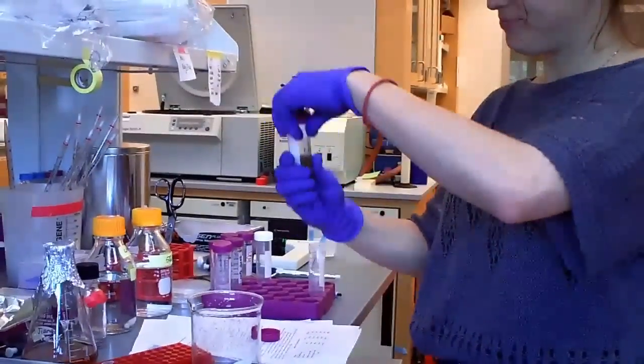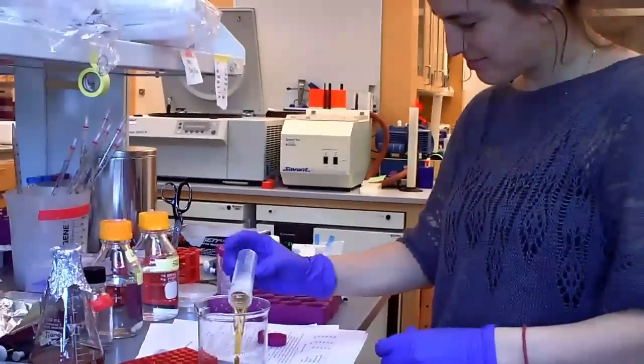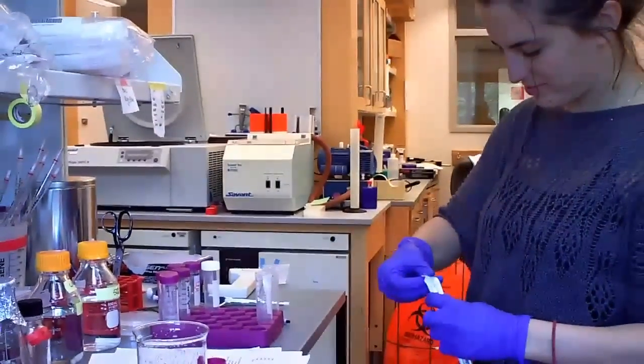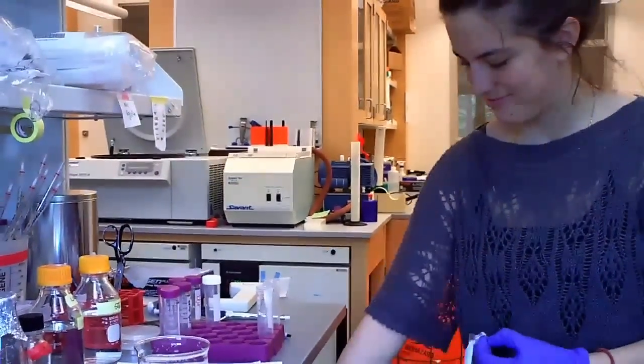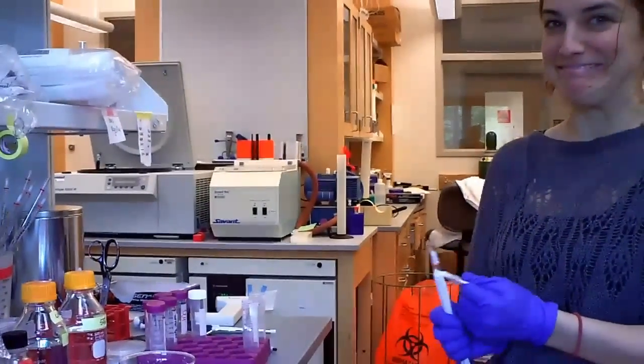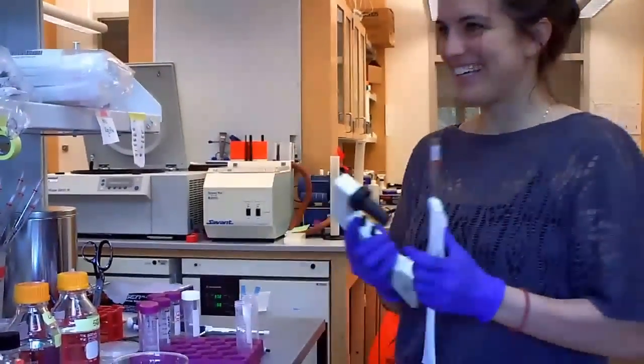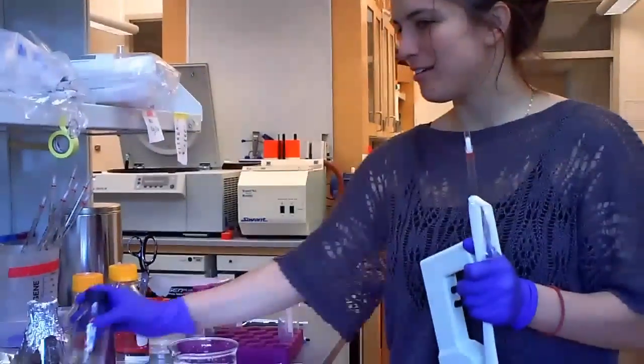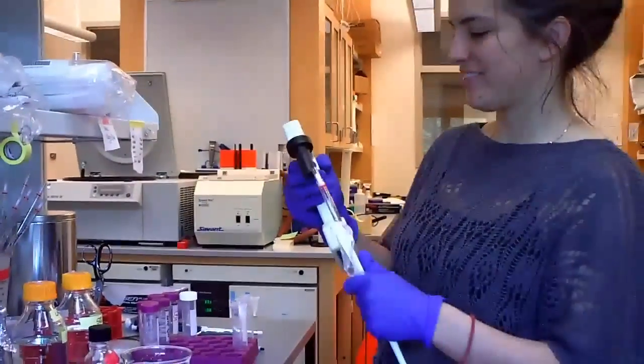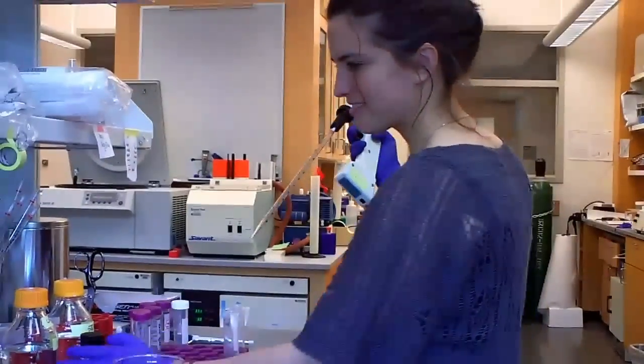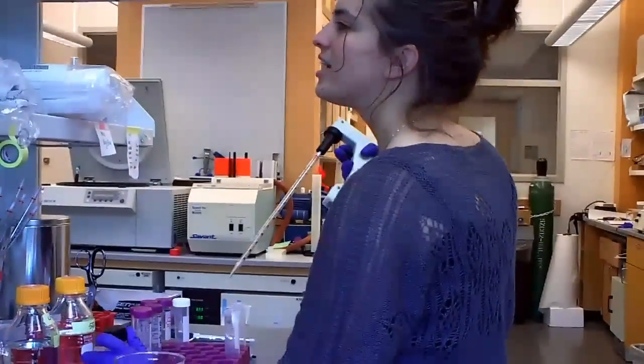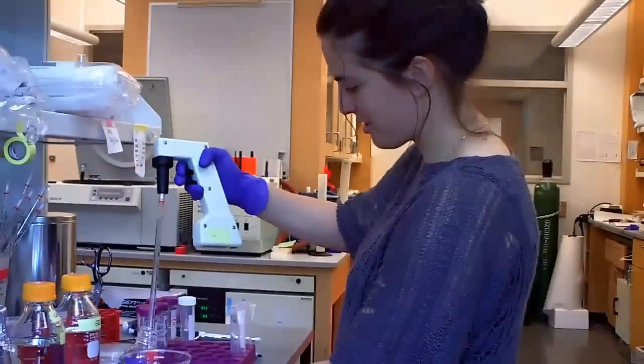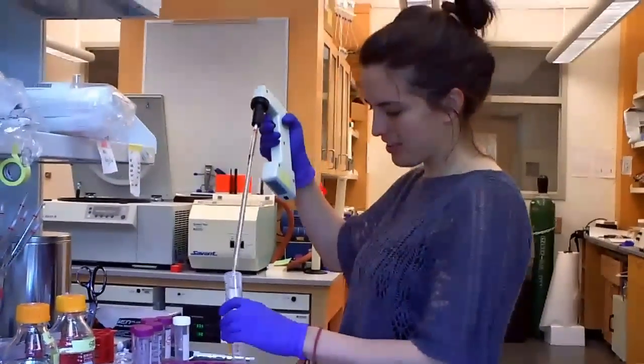Teeny little amount of cells. I need to wash it once with water. It says wash it in 25 ml. So I'll do it in 12 each once I split it into two.